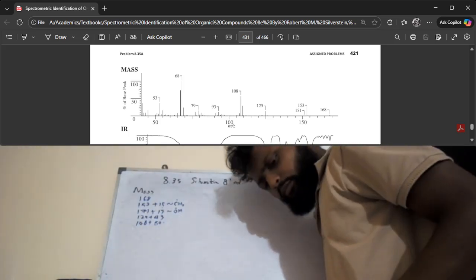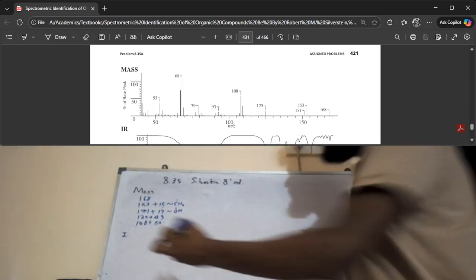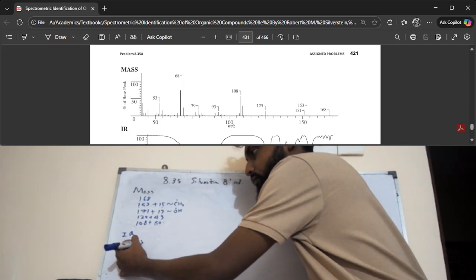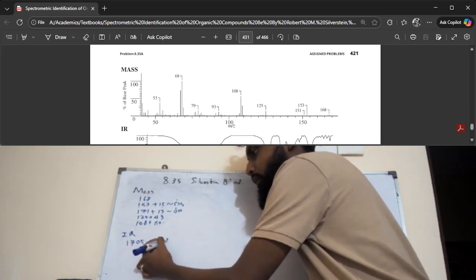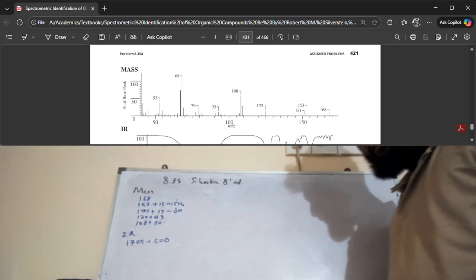Then you have the IR peaks. In the IR, you have a peak at 1705. So that may be a carbon oxygen double bond. Now that doesn't mean it's a ketone, it could be a carboxylic acid derivative as well. It's just a carbon oxygen double bond.